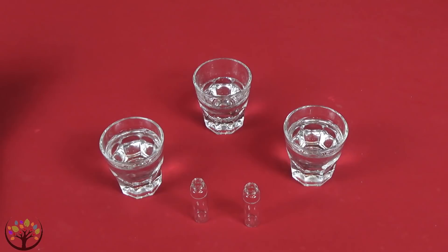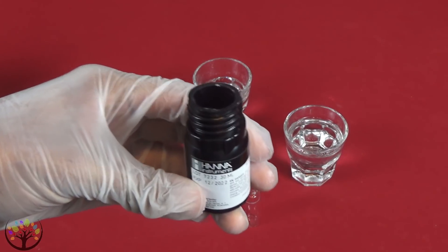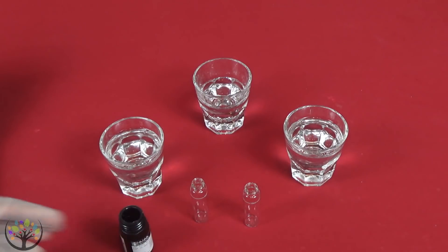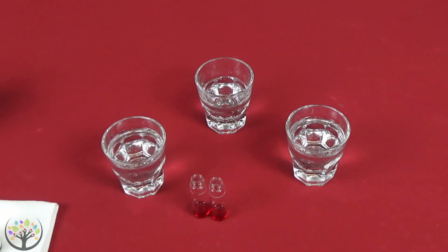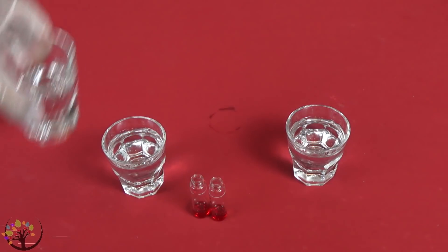The glass in the center is actually some distilled water I need for the test. So this is a chemical that's going to help determine if there's fluoride in the water. I need to put two milliliters into these little containers here. We're going to attempt to do that without spilling any on the table. Now that I have approximately two milliliters of the chemical, I need to create a control, so I'm going to use the distilled water. It calls for deionized water but I can use distilled water in its place. I inject eight milliliters of the distilled water into one of the containers.